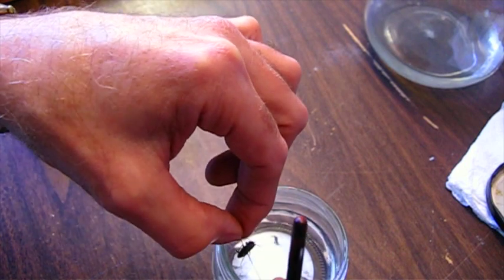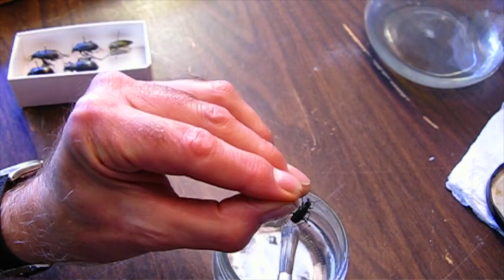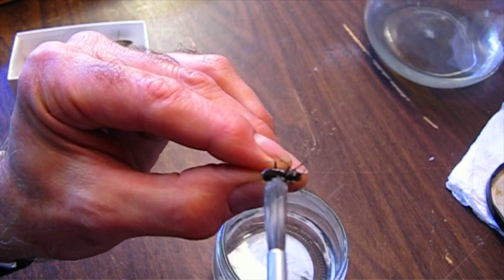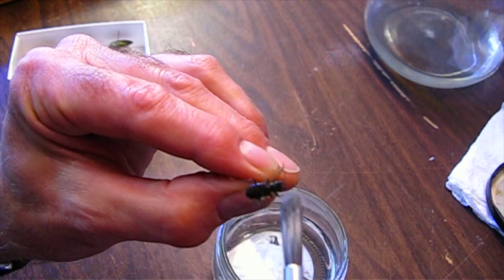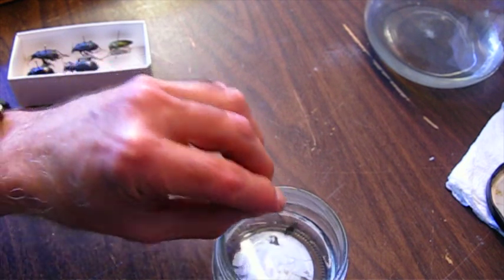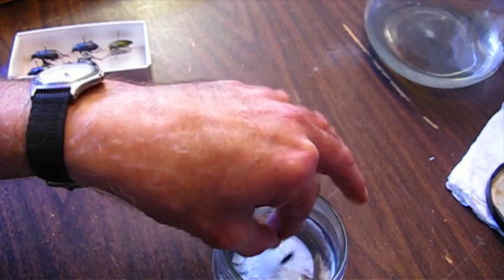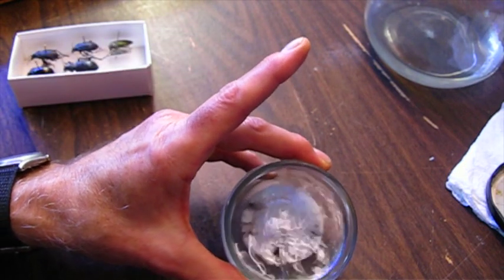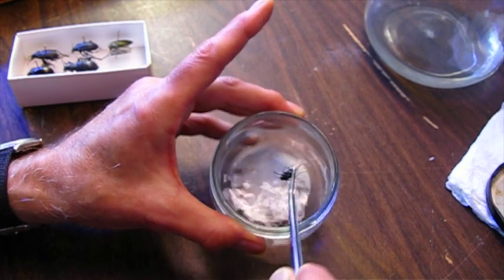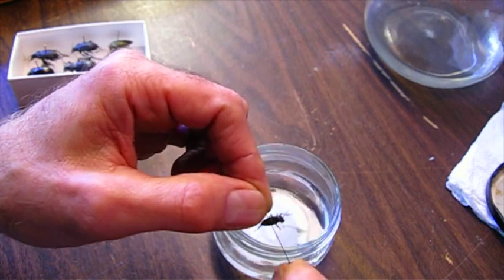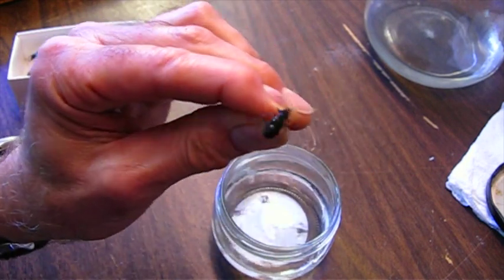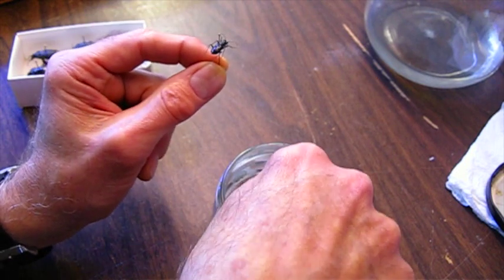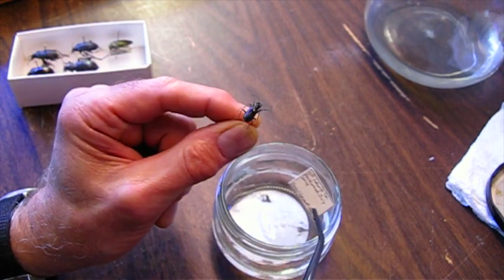Now I'm going to do the top. Even if there's still some filament stuck to it when I'm finished, at least I'll have killed it. Swish it around really good, try and dislodge as much of that as possible. That looks pretty good. This label looks pretty good too, so I'm just going to dip that in acetone just to sterilize it.